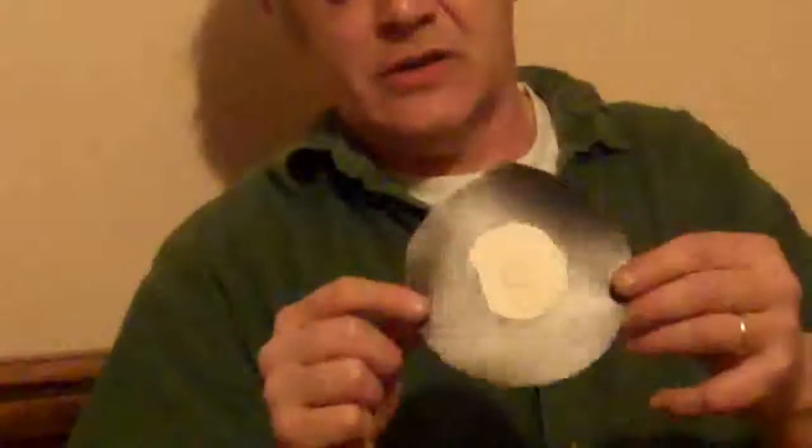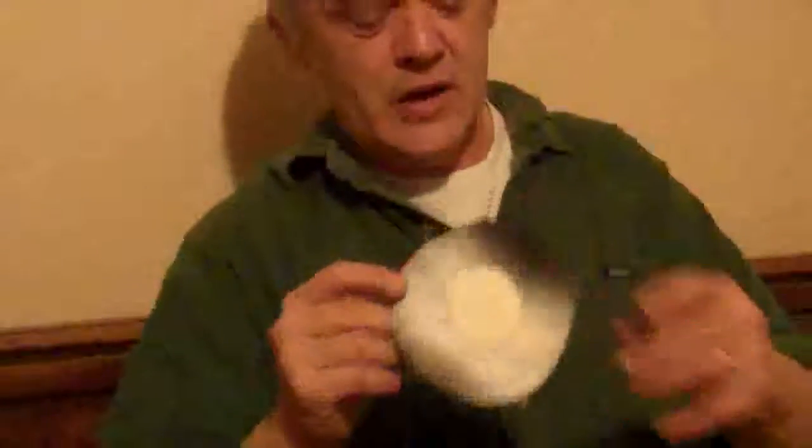And this is what you get — a piece of paper that's quite brown from the heat and quite crinkly, with your reduced graphene oxide as a nice black square that's actually quite conductive: about 15 to 20 ohms per centimetre. The back is just browned up from the oven heat. I also did one on the light scribe device — as you can see the paper hasn't suffered nearly as much, and we've got a nice graphene coating on the top. You can see it's black and shiny, catching that metallic shine as it moves in the light — telling you it's graphene, not just carbon.